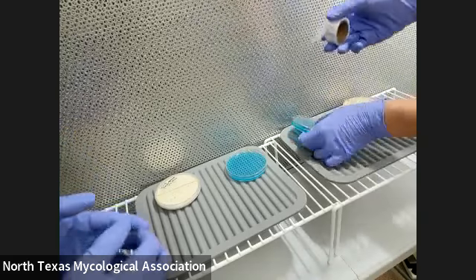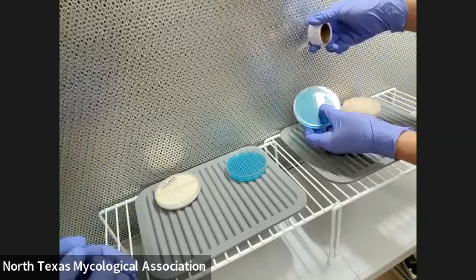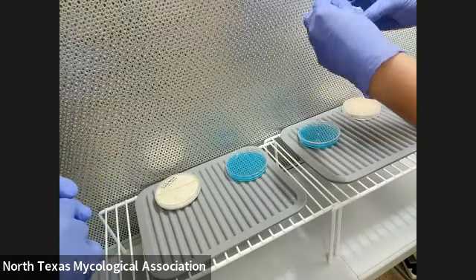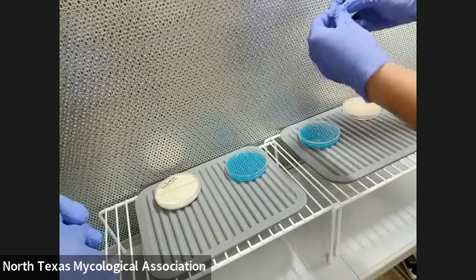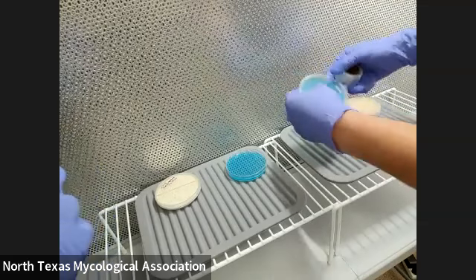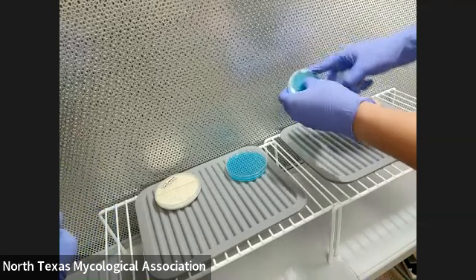We're just going to wrap it around the plate twice. Sometimes this happens — it's not cut very well. I'll fix it before the class comes. And then just make sure it's tight.